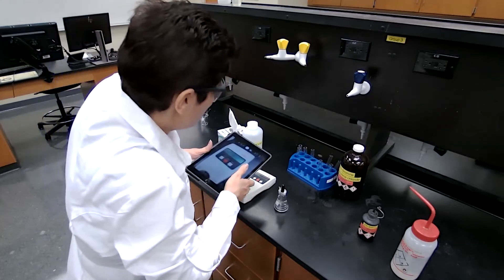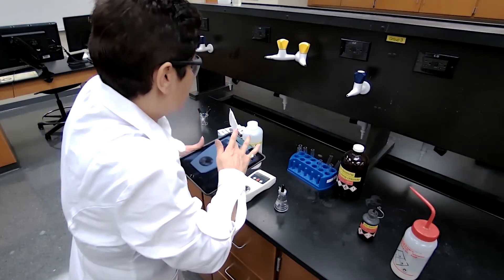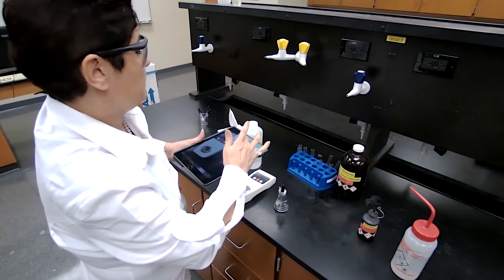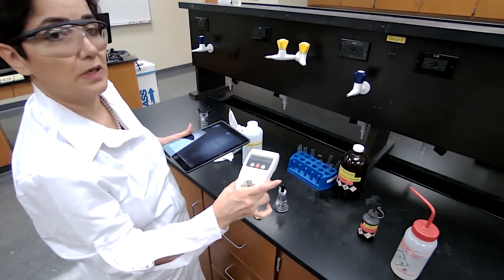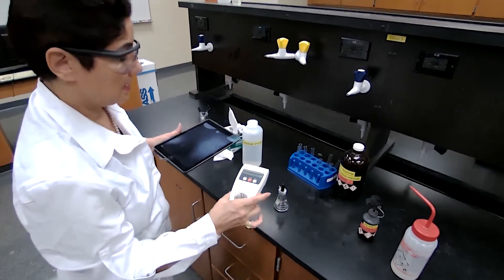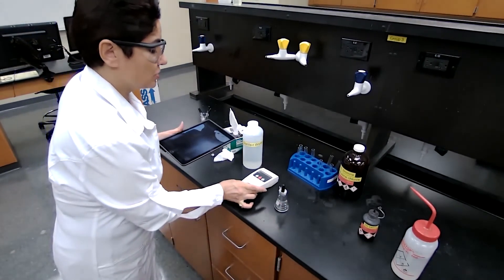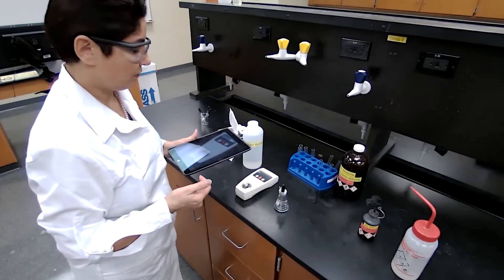It is reading the sample. I'm going to take a picture and also show you the number if you could see it from there, but I will add the picture to the video.